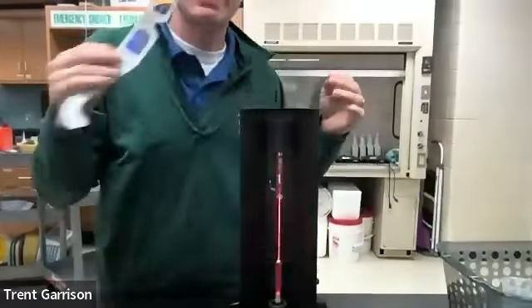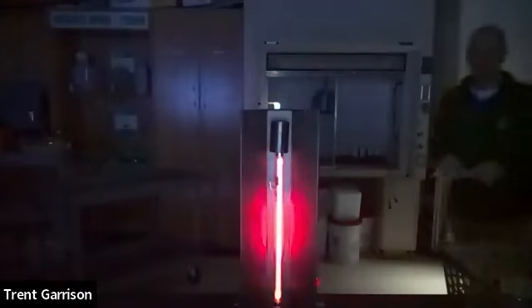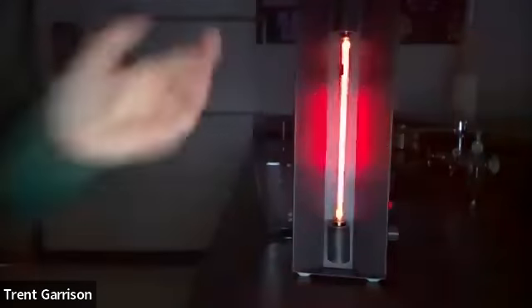Well, I'm going to do the same thing here and see what happens getting close to this image here. Boy, that's going to give you a seizure if nothing else. So let's see if you can see what happens as we put this over the camera lens. Now notice off to the very right, you will start to see that it splits up this color a little bit better. So notice those lines right there.